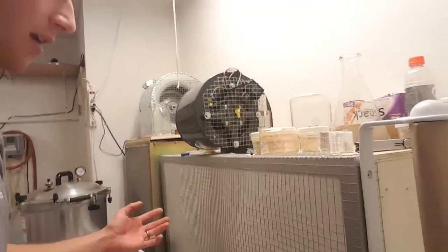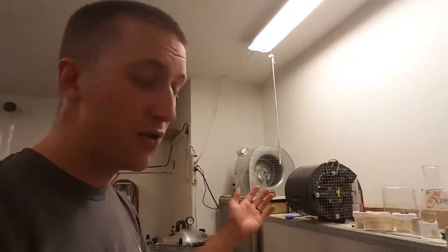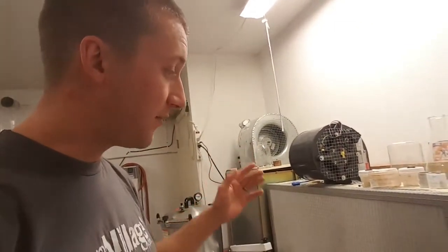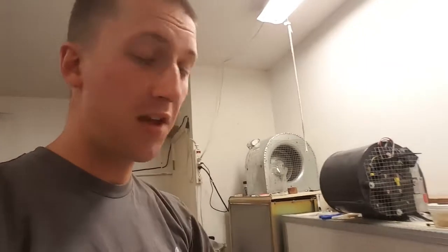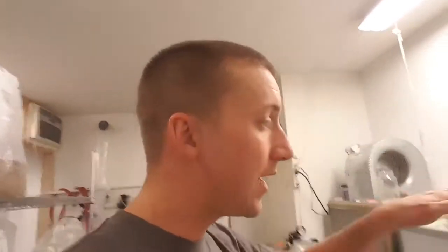You can put your finger through the filter and ruin a $100 filter really quick. I work in front of this every week doing 40 to 100 bags, and it's easy to put a scalpel blade through it while you're moving around — I've done it twice already. If you do get holes in your filter, hot glue works — just lay it on its face and fill the whole cell all the way back, not just where the crack is.